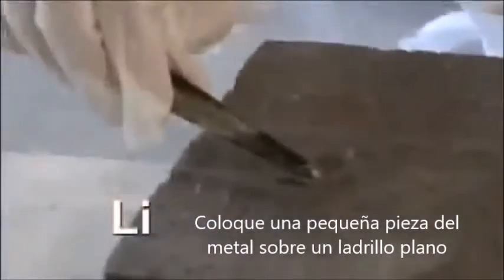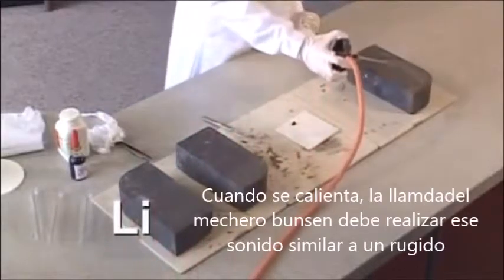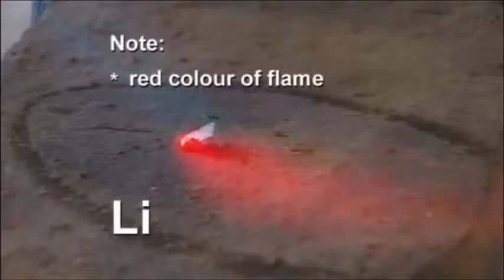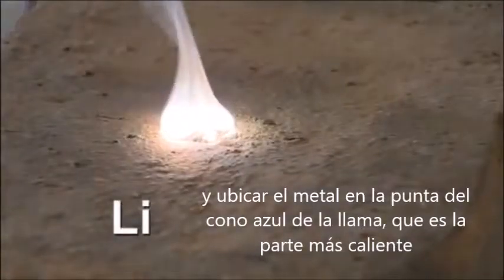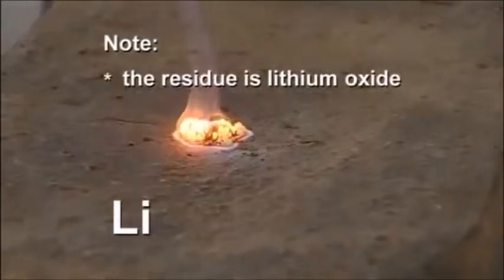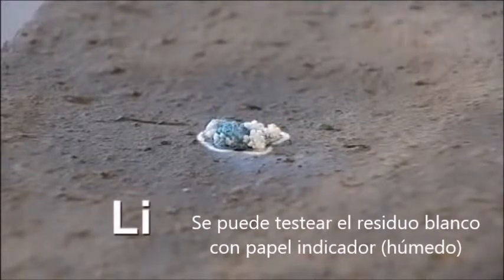Place the little bit of metal on a flat brick. When heating the metal, you need to use a roaring Bunsen flame and position the metal at the top of the blue cone, which is the hottest part. You can test the white residue with some moist indicator paper.